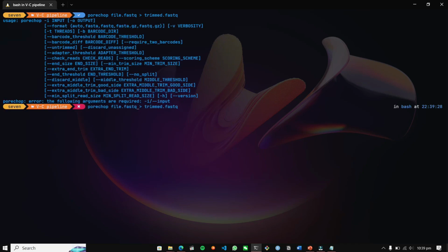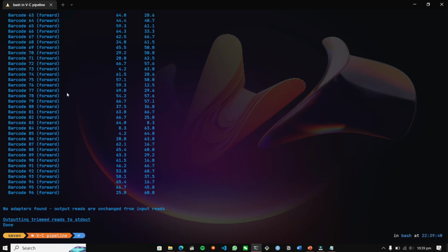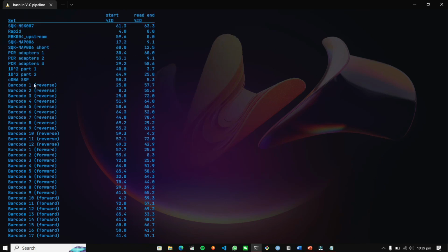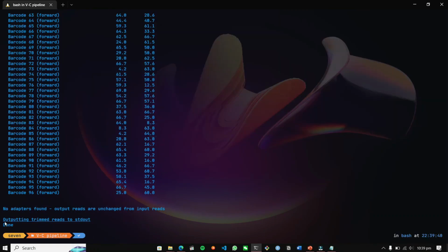Yes, it is saying that I haven't enabled the input. Sorry for that. Yes, here you can see again. I'm going to perform this, and here you can see it is loading the reads. There were two reads loaded, and the two reads don't have any kind of adapter set. The reads were divided into several barcodes, forward and reverse, and no adapters were found. Output was unchanged. There wasn't any change in our output.